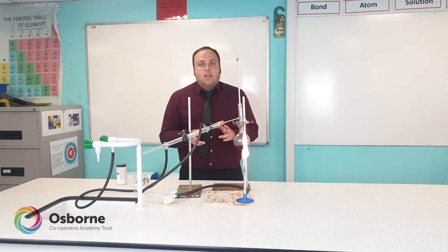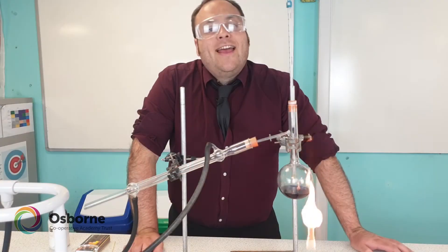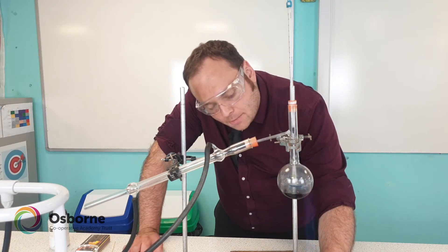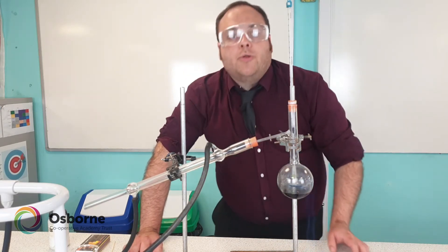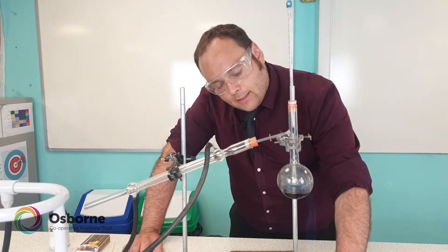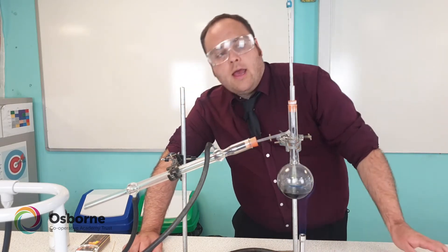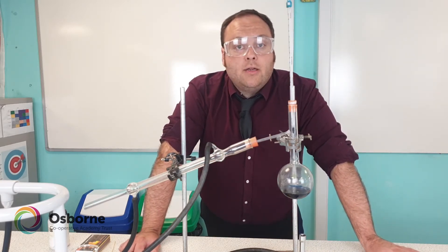I'm about ready to start the distillation process now, so I'll put some eye protection on. To get the Bunsen burner ready I'm going to turn the air hole about halfway so we get a nice blue flame — I don't want it roaring because that's going to boil the mixture too quickly and be harder to control. I'm then going to carefully slide the Bunsen burner underneath the round bottom flask and now we wait until the mixture starts to boil.